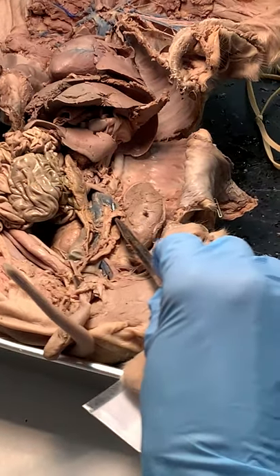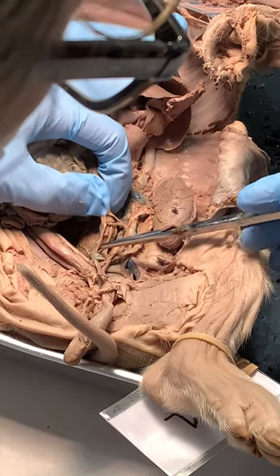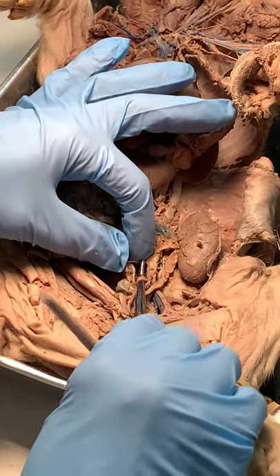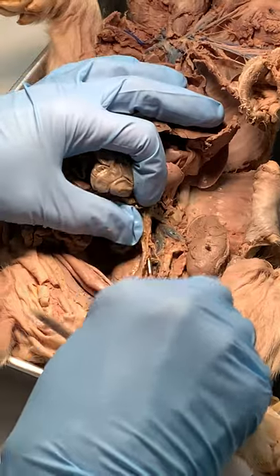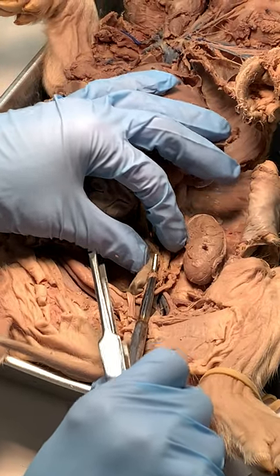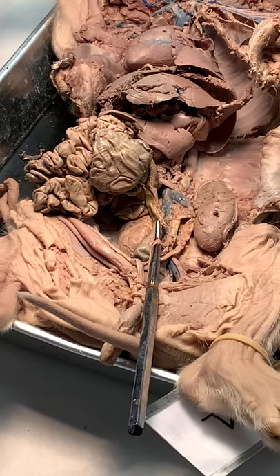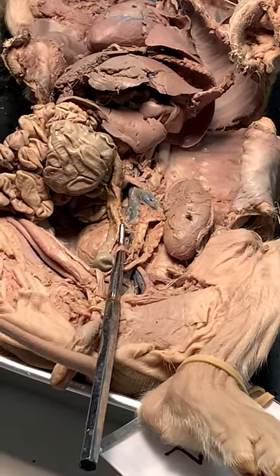Now let's go on down. The next thing we'll see — this one's a little bit tiny, maybe torn just a little bit. There it is. I'm going to show you the gonadal in just a minute, but there's that descending colon, that green thing going down. It goes all the way to the rectum and then out the anus. The bridge between the aorta and the descending colon is the posterior mesenteric. It'll be pinned just like that. So that's the posterior mesenteric going to the descending colon.